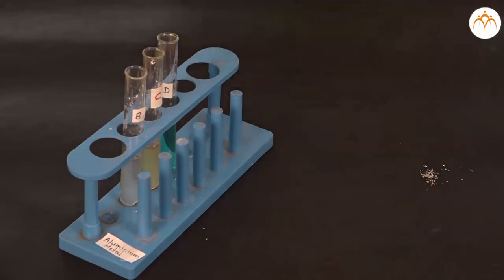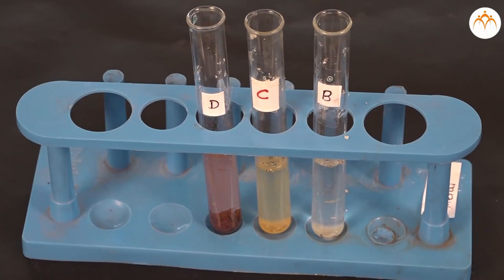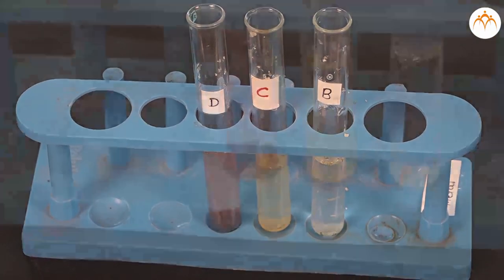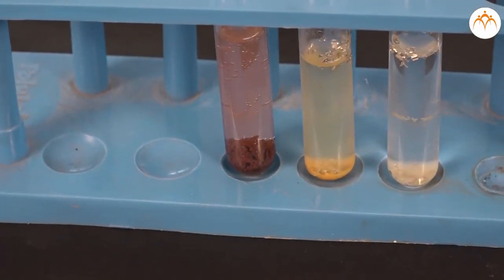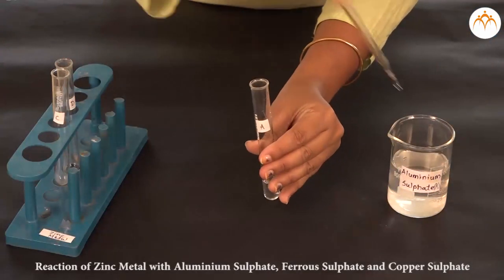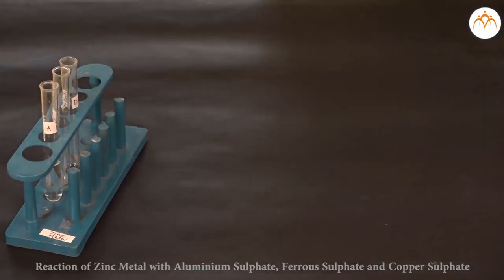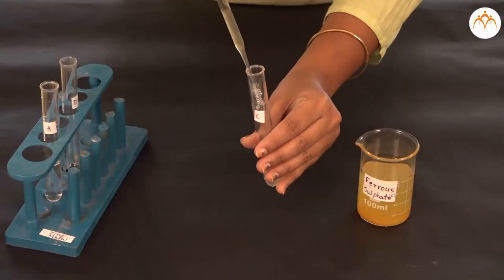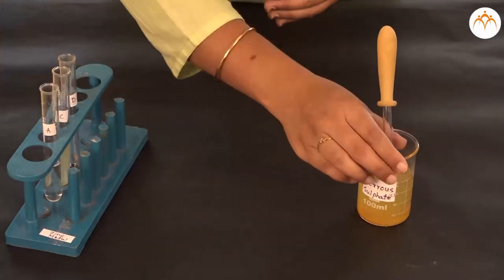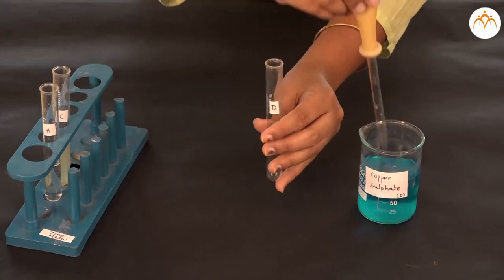Part B: Now let's add zinc metal to aluminum sulfate, ferrous sulfate, and copper sulfate solutions. Observe the changes.